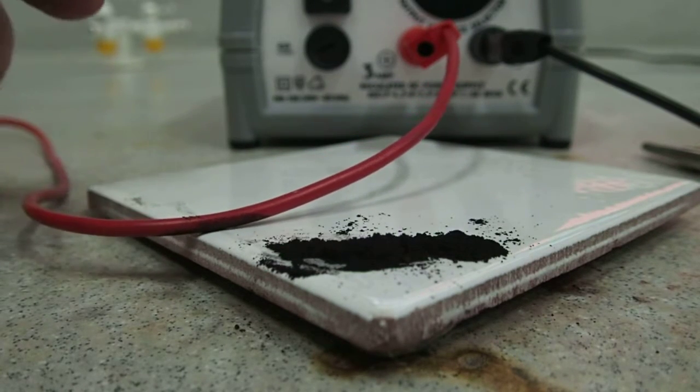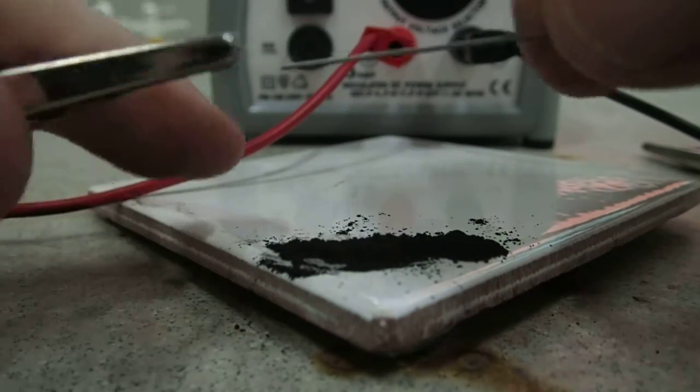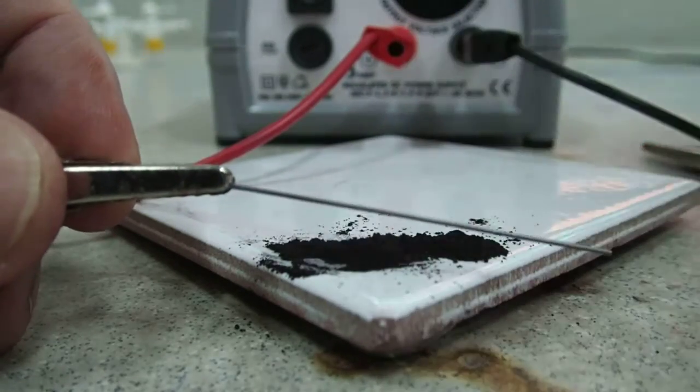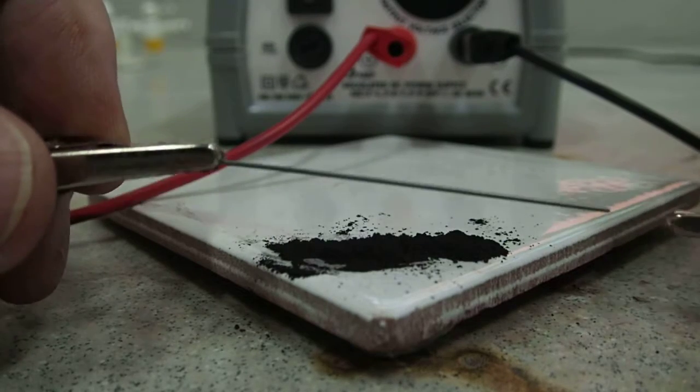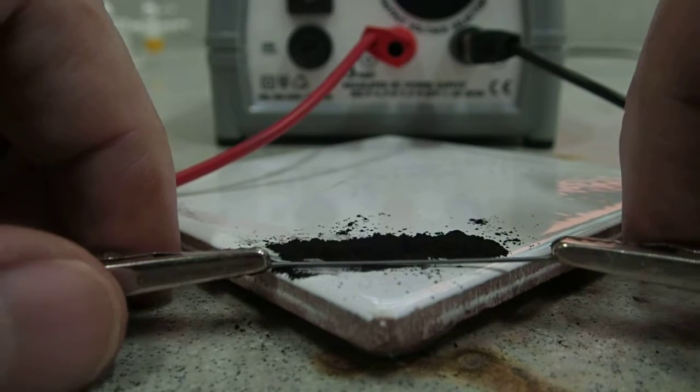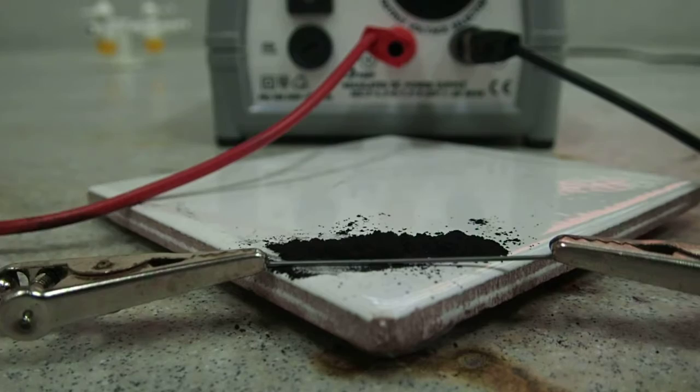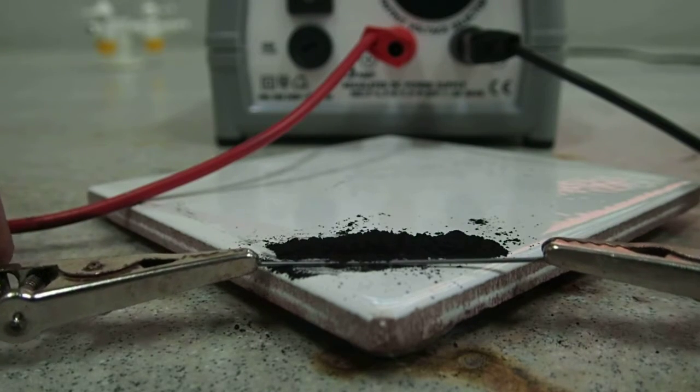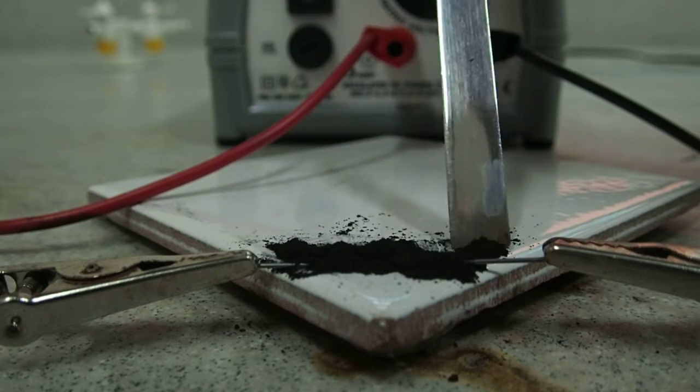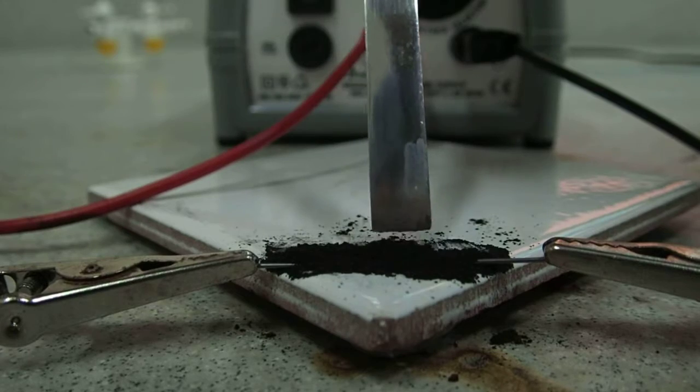Crocodile clips, carefully. Just better move that wire. Here's one end and here's the second, and we set that up so it's in line with the material on the tile. It needs to be quite flat with the tile, and then we encourage the mixture to encase or cover the pencil lead.